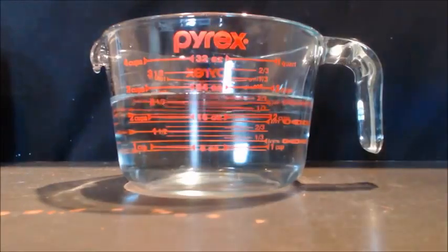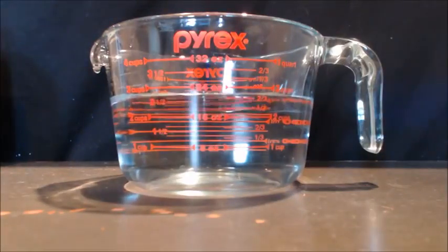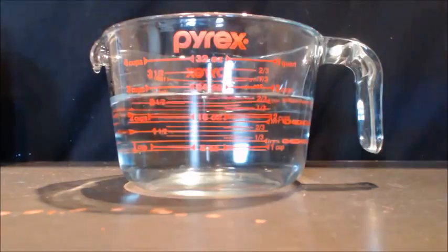One thing I learned — this is my first filmed experiment — is that when you're adding the alcohol or the permanganate, you need to cool everything down. Put an ice bath on the pot you're dripping into and have everything cold. That way the acetaldehyde, which just escapes otherwise, is much easier to control, because that stuff is really soluble when it's cold.